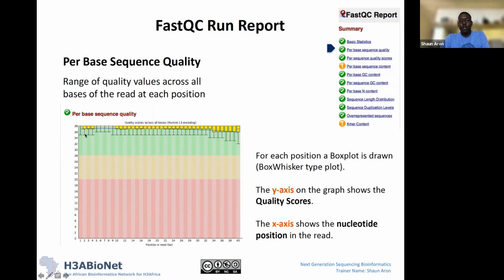Our quality scores range, for example for position 2, from 35 to 38. And you'll see for the majority of our reads, the quality score is between 37 and 38. This is color-coded, and we'll come back to this a bit later, to give you some indication of what we consider good quality. We go into green around 28, and 28 and up is green because we consider that good quality. This is sort of in between, and below 20 we consider low quality calls.